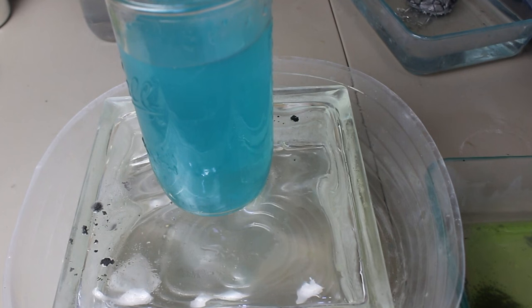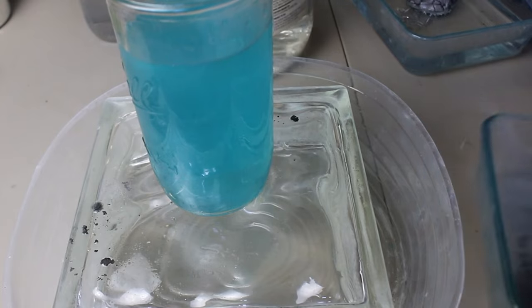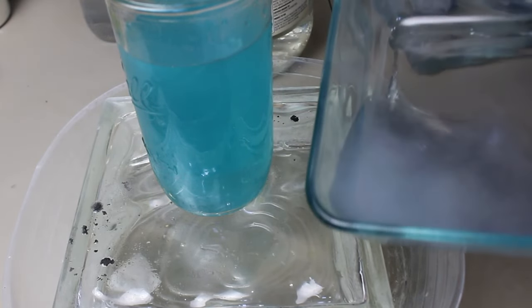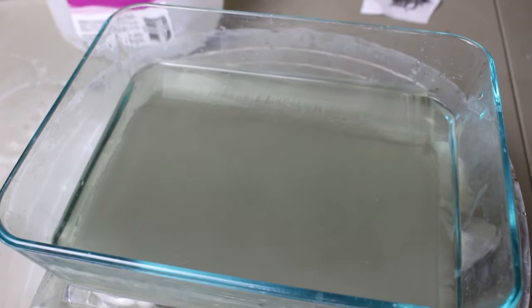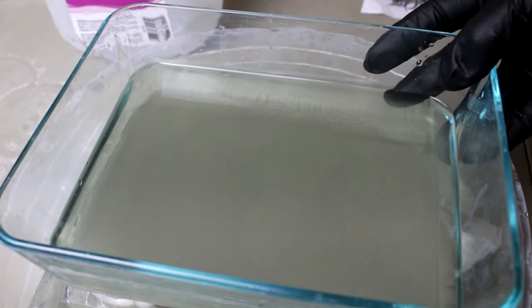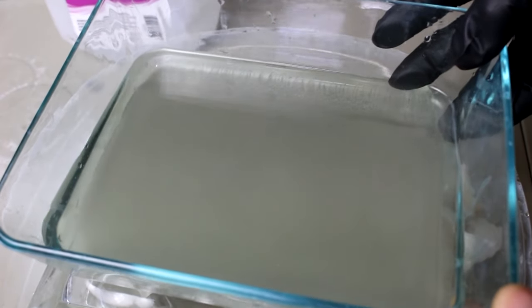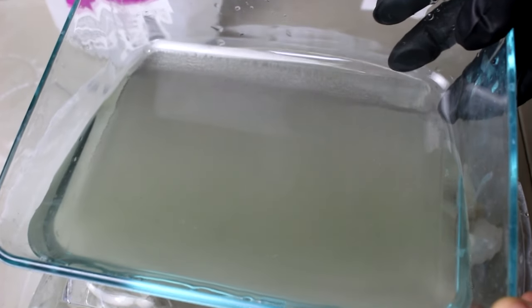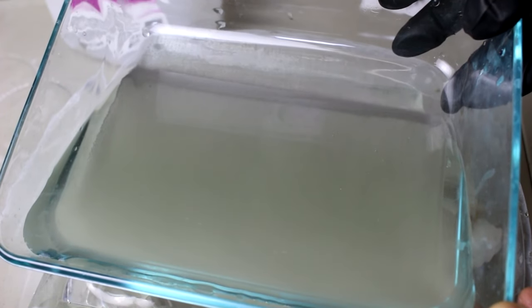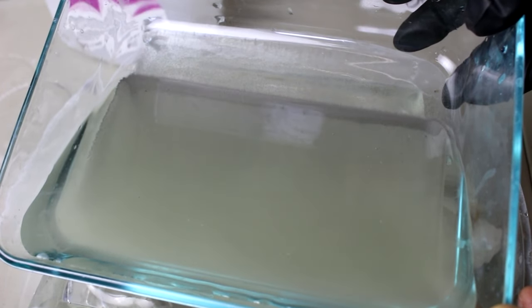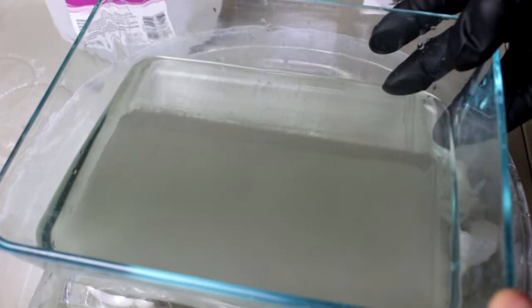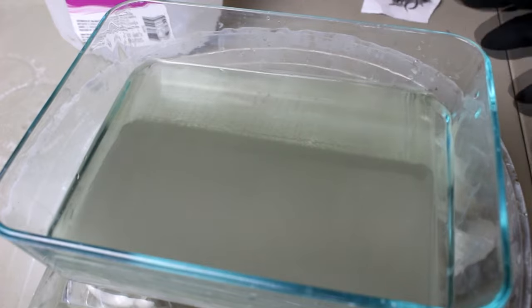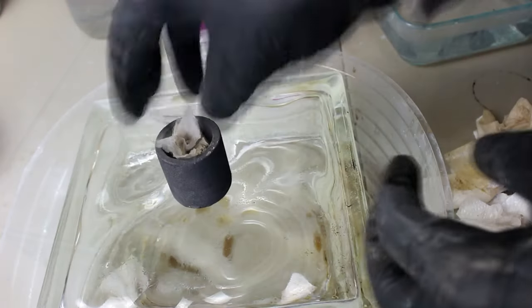Let me, uh, let's wash this off. So that's really all of our silver. After letting it settle out, washing it, settling out again, I'm left with this. Now, this is primarily silver chloride, but there's not very much here. Now, it might look like a bunch, but having refined silver before, I know that there's, you know, it really expands when it's in water like this. So this is probably much less than a gram here. But we'll put it into a crucible and furnace it down anyway.